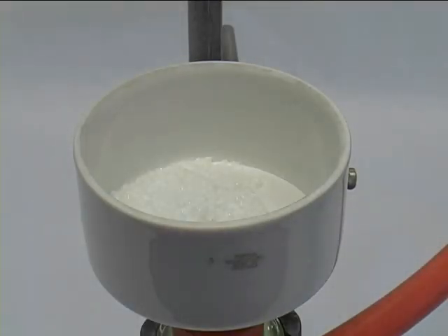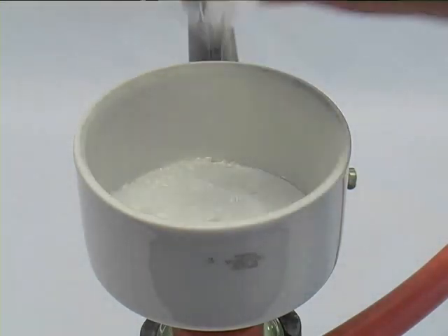If you need to wash anything out of the conical flask, do so with the minimum amount of cold solvent.